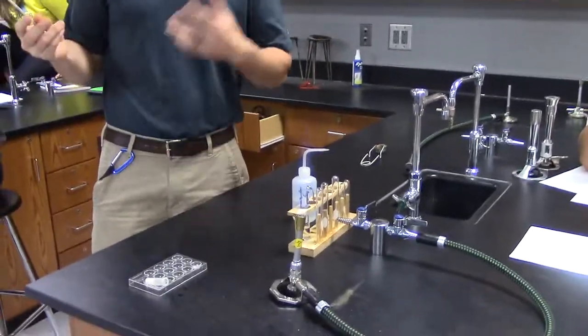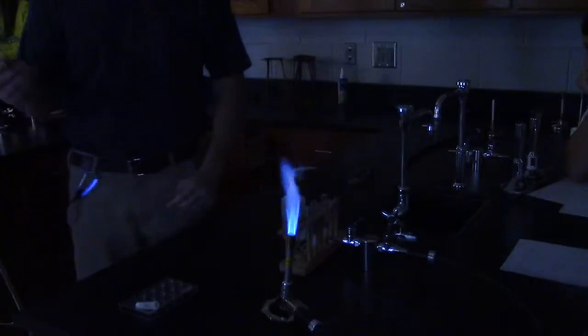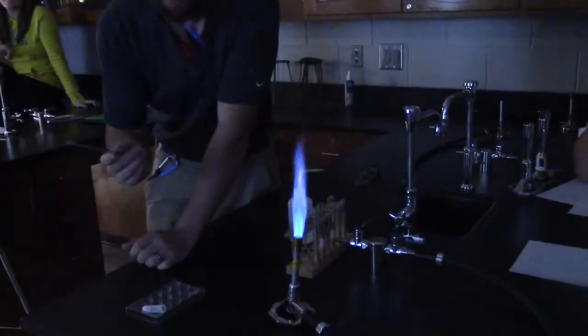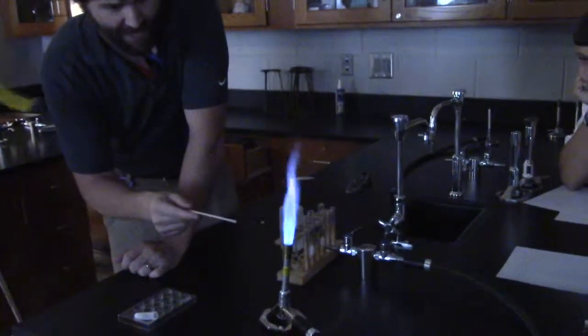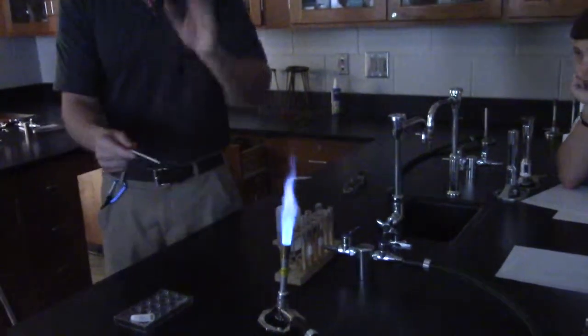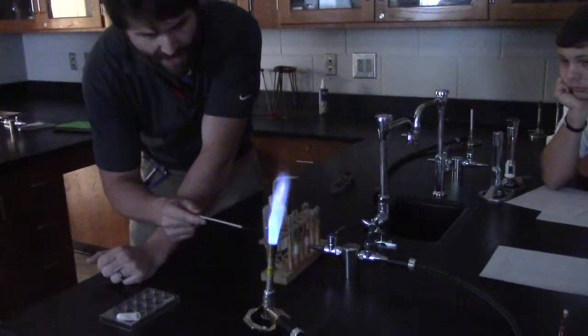It sticks. Now this is where I'm going to ask Amberly to turn the light off for us. By the way, in the lab tomorrow we'll have the lights off for the whole lab so you can see, because y'all got to see the colors of these burns. I do not want to stick it dead center. All I want to do is get it on the edge so if it drips, it doesn't drip right down the center of the burner. So I'm going to get right on the edge.